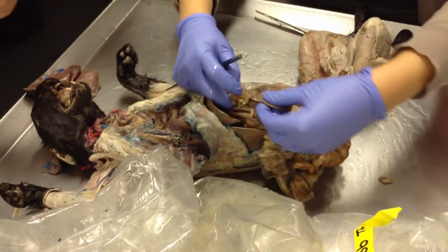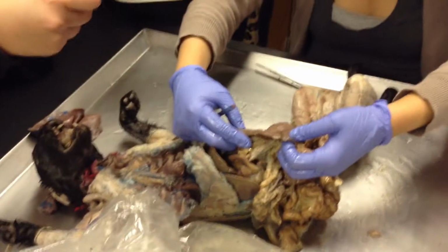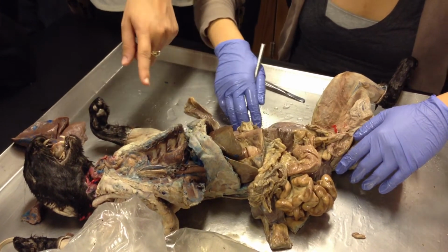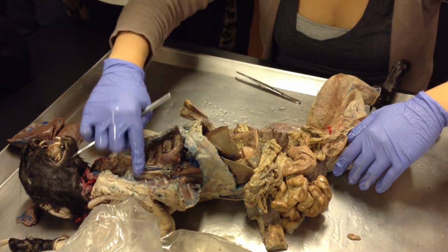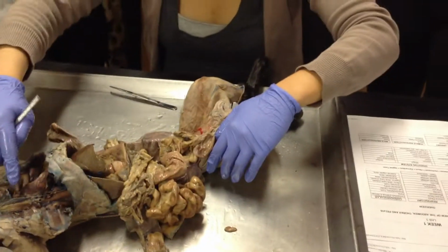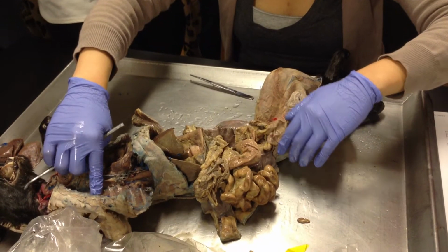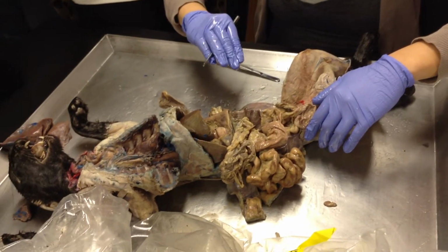What is this, by the way? This right here? This is the spleen. That is the spleen. Excellent. Okay. What else haven't I talked about? Is this the visceral pericardium? Is it visceral peritoneum? No. Right here? Visceral pleura. There you go. I was looking at your sheet. Is that what it is? This right here is the parietal pleura because it's lining the thoracic body wall. But if it lines the lung itself, it's the visceral pleura.